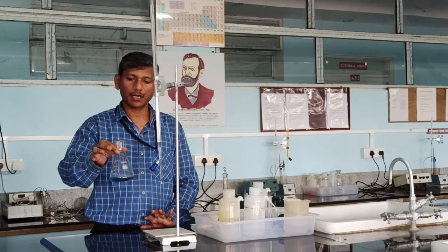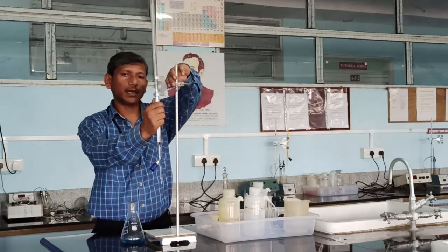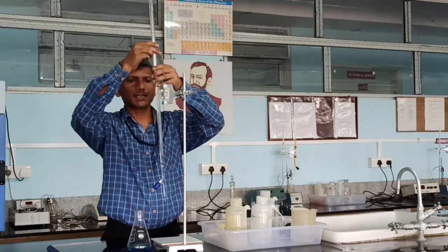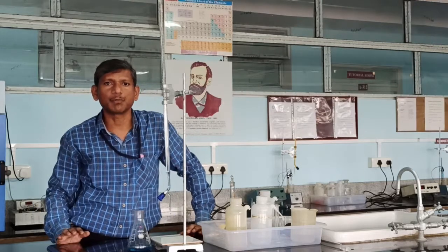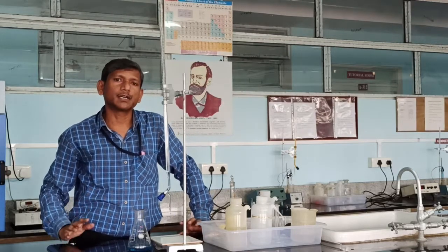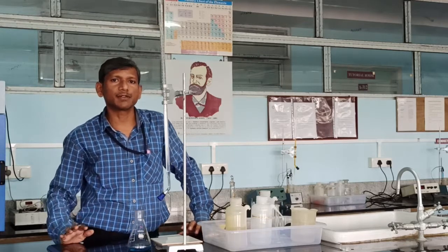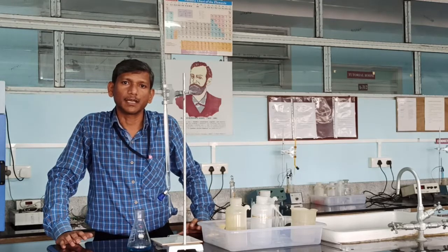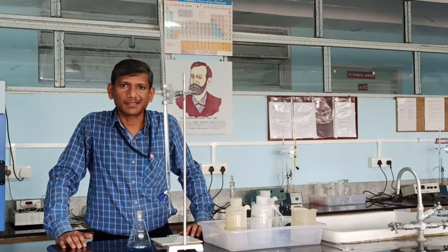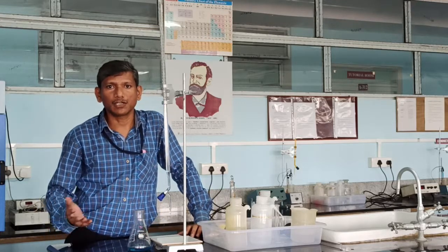The blue color at pH 10 is due to the free indicator. Remove the burette from the stand and read the volume. This value is used to calculate the total hardness of water. The total hardness of water is expressed in terms of ppm of calcium carbonate (CaCO₃). Although hardness is caused by chlorides, sulfates, and bicarbonates of calcium and magnesium, we express it in terms of CaCO₃ because calcium carbonate is highly insoluble and its molecular mass is conveniently 100. All hardness-causing substances are thus converted into equivalent calcium carbonate for the calculation.